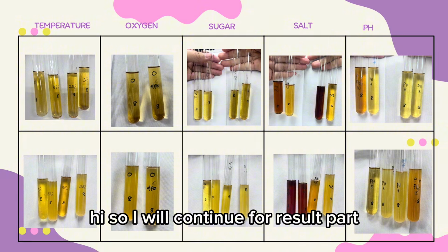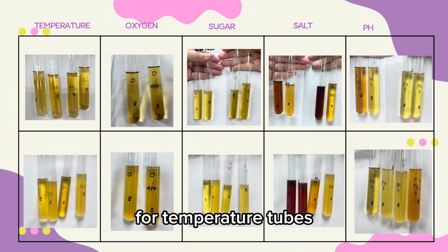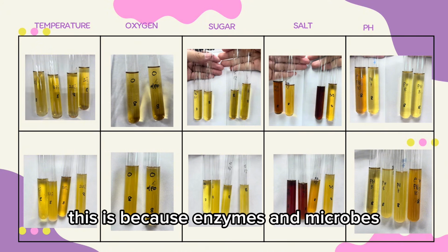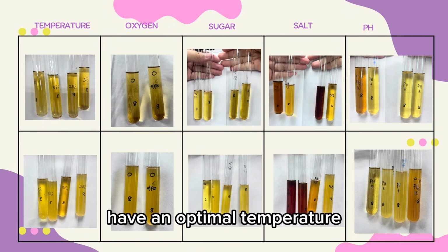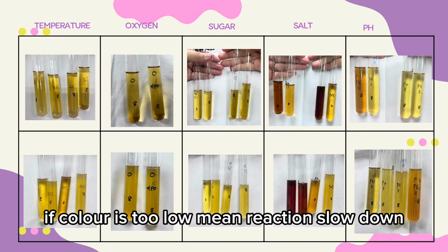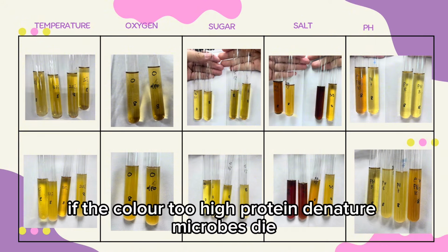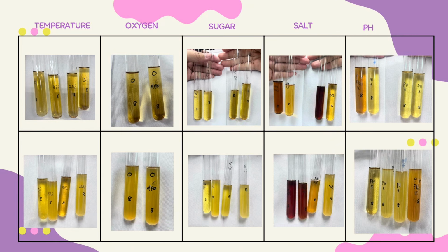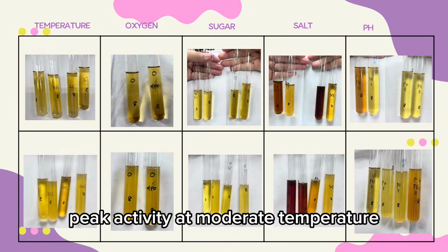Hi, so I will continue for the result part. For temperature, tubes differ in color intensity across the temperature range. This is because enzymes and microbes have an optimal temperature where activity is highest, which is the strongest color. If the temperature is too low, the reaction slows down. If it is too high, protein denatures, microbes die, leading to weak or no color change. The pattern likely shows peak activity at moderate temperature.